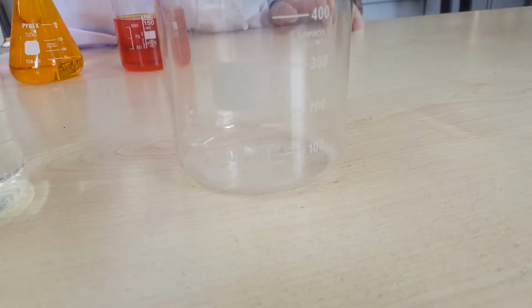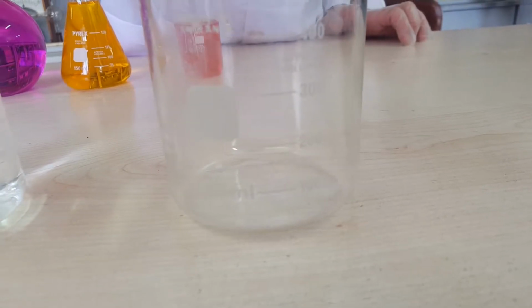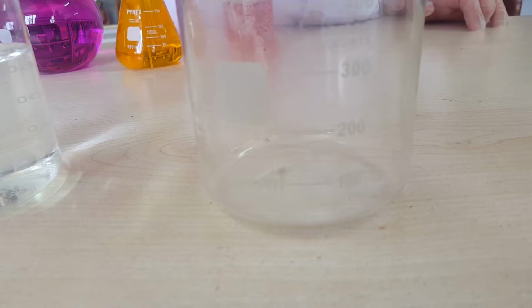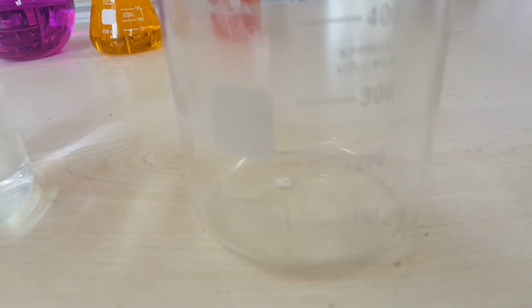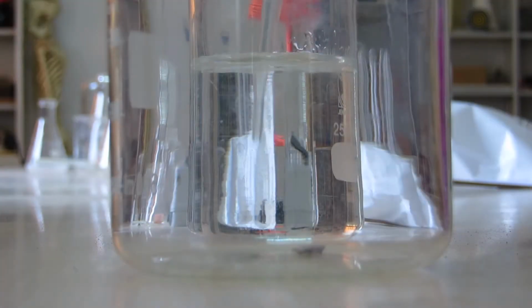As water touches the sodium, you can see a gas release that is hydrogen. A result of this reaction is sodium hydroxide. A flame of heat is coming out that freaks out our cameraman, and now you can see it from the side.